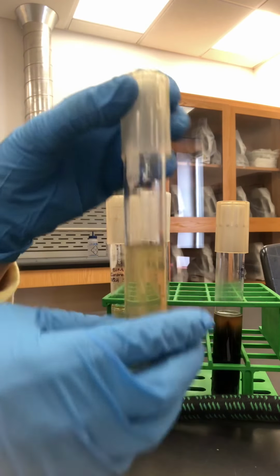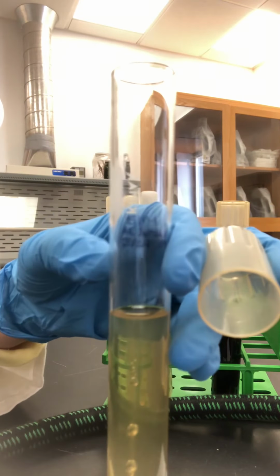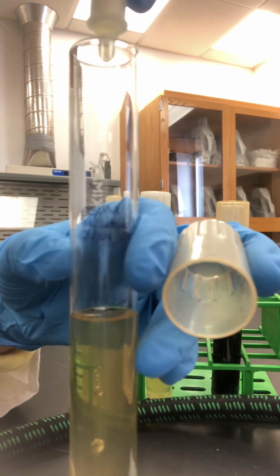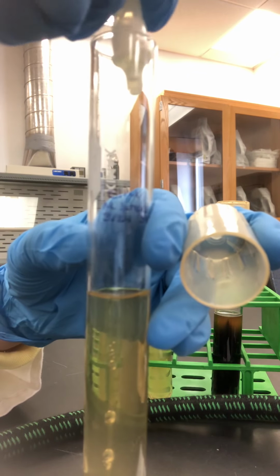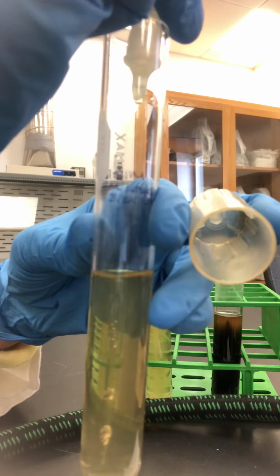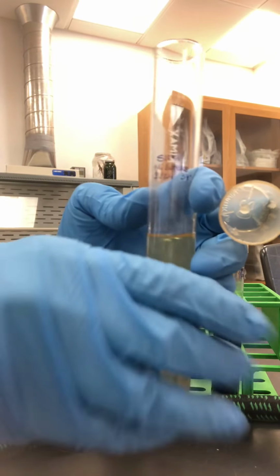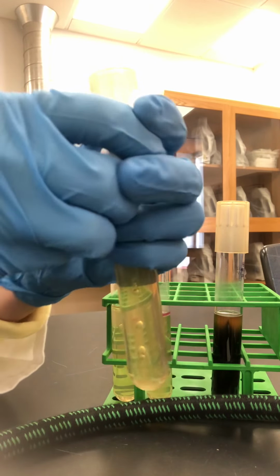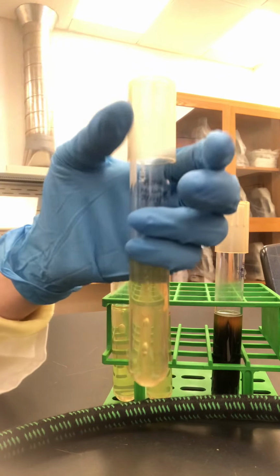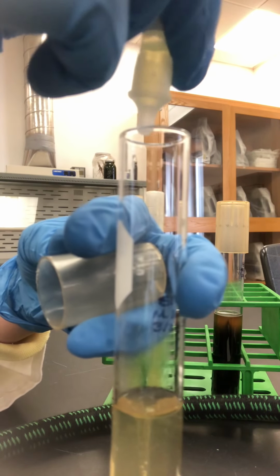Okay, your next one is Micrococcus luteus. We'll test that for indole production. So dropping our Kovacs onto the Micrococcus luteus. Running out of drops, so I'm going to open my next one. Just like before, crack that glass tube and then drop it in.